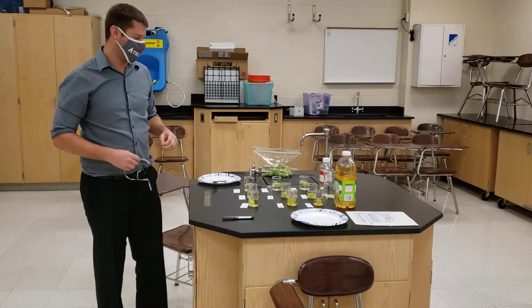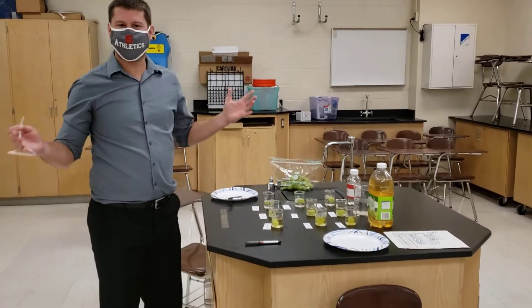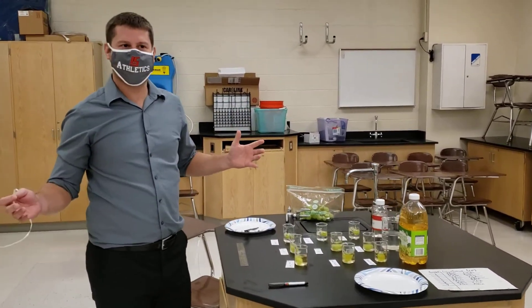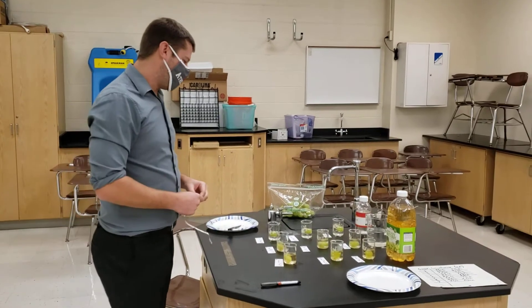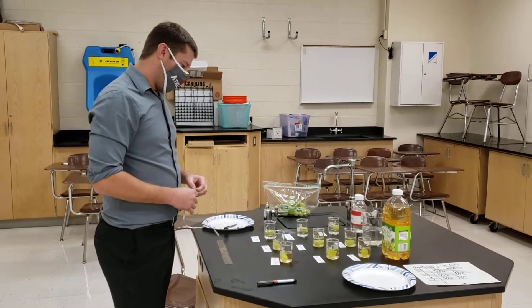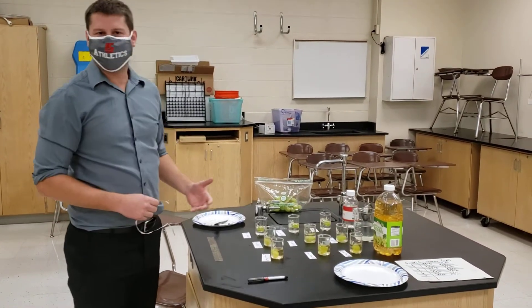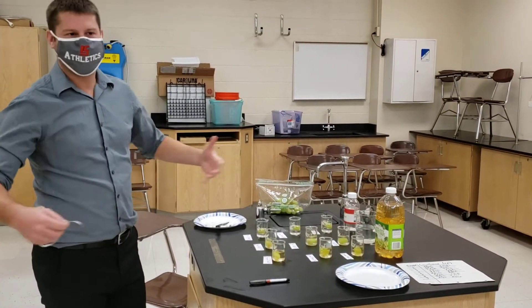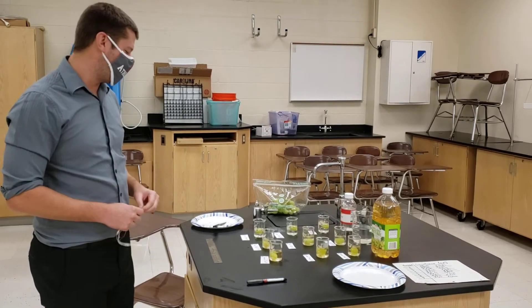Hello Biology students, Mr. Guaz again. So 24 hours have passed since our experiment has taken place. What I'm going to do is measure one for time's sake, because we're going to give you the rest of the data.